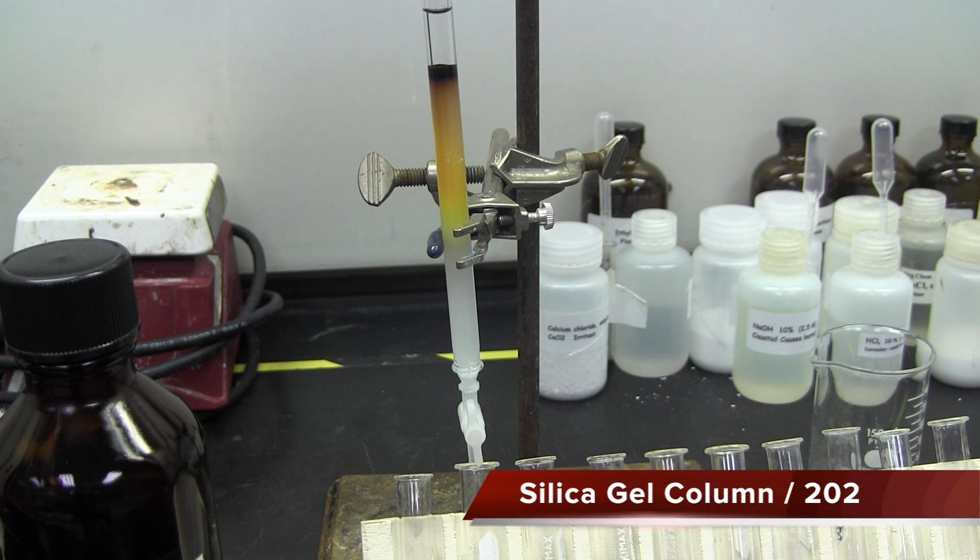In this lab, you will learn how to pack a silica gel column, as well as using TLC plates to combine like fractions.